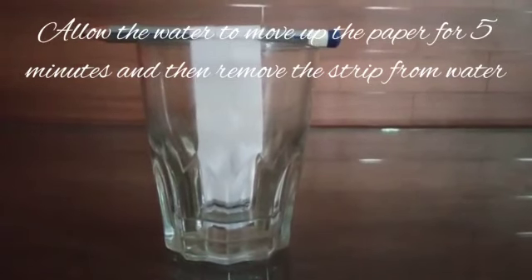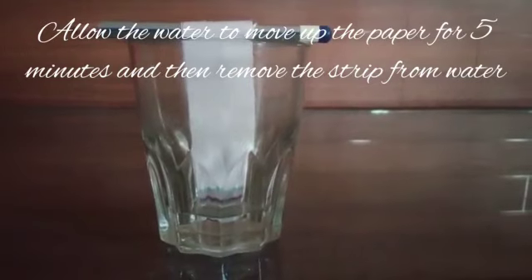Allow the water to move up the paper for 5 minutes and then remove the strip from water.